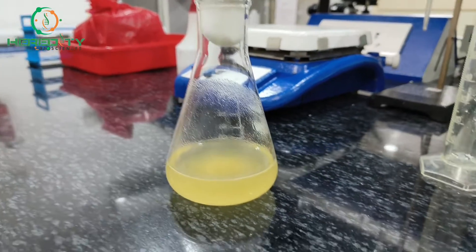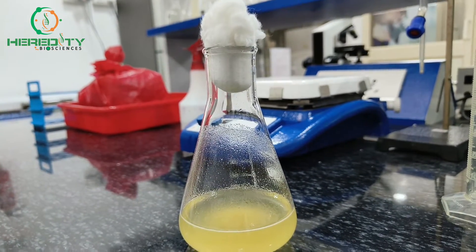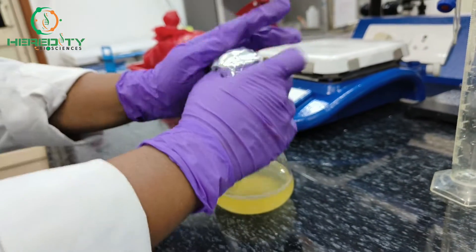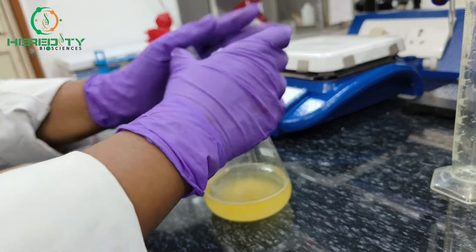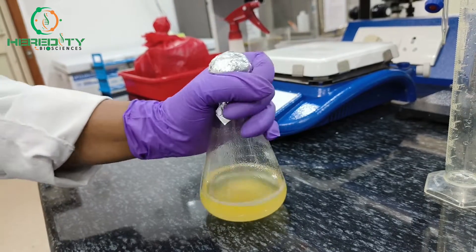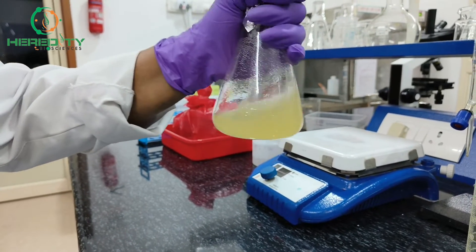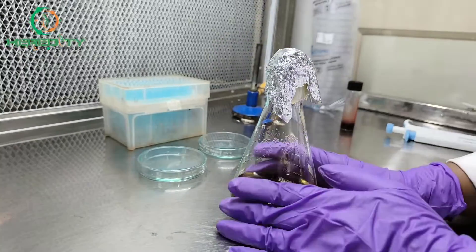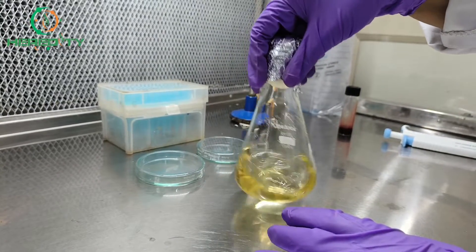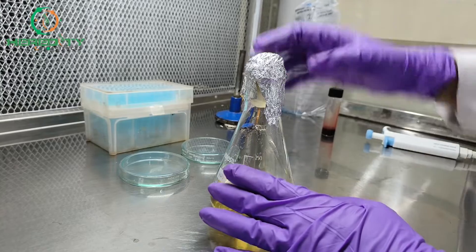After that we will plug it for autoclave. Plug it tightly. Now it is ready for autoclave. We will put it at 121 degrees Celsius for 15 minutes. After autoclaving, let it cool down to 40 to 50 degrees. At that time we will add blood. Now its temperature is around 45 to 50 degrees.